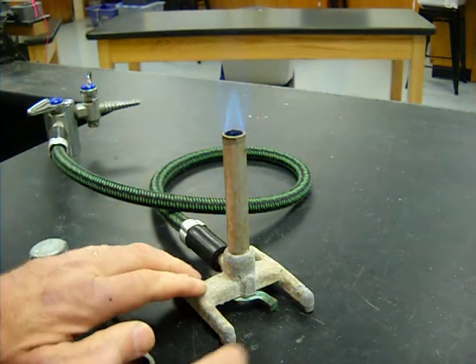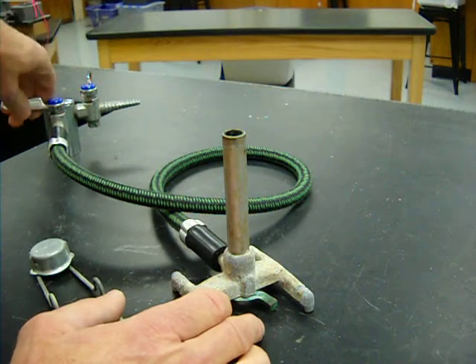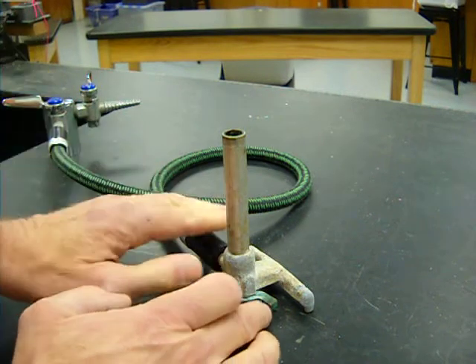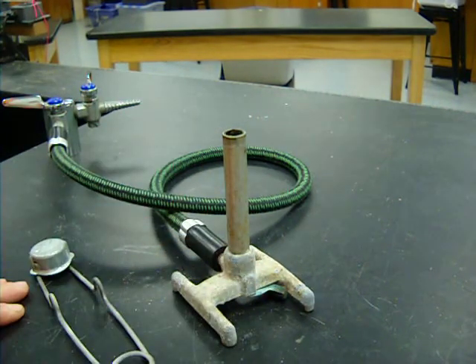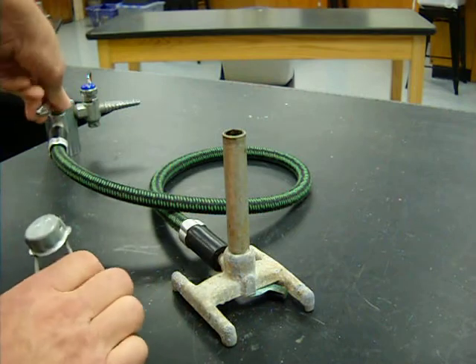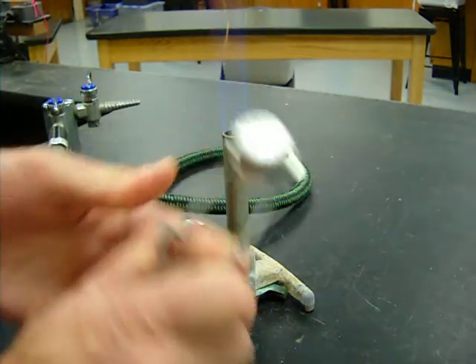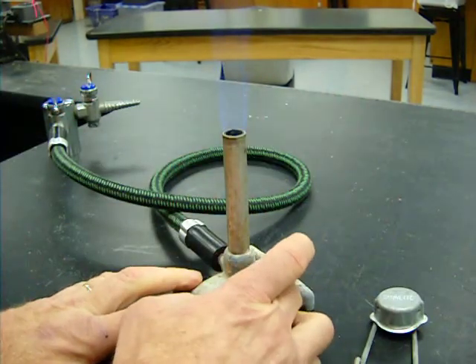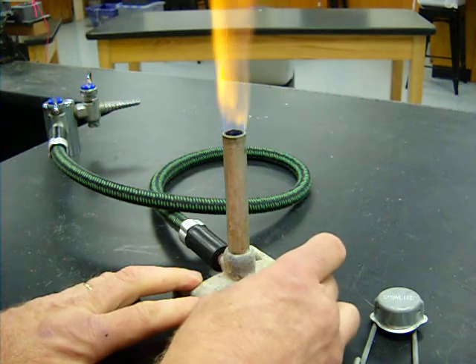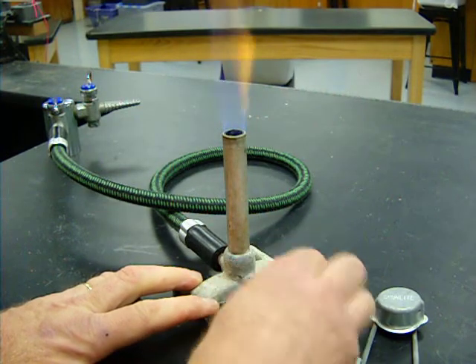Let's go through that one more time. When I shut off the burner, I turn off the gas. Always turn off the gas. Shut down the air. Let's open up the gas again. Strike the flame. Add a little bit of oxygen by opening our lower valve.